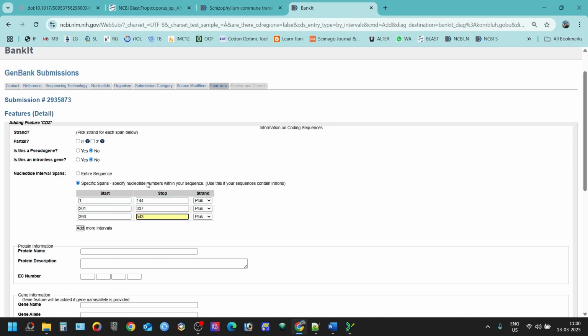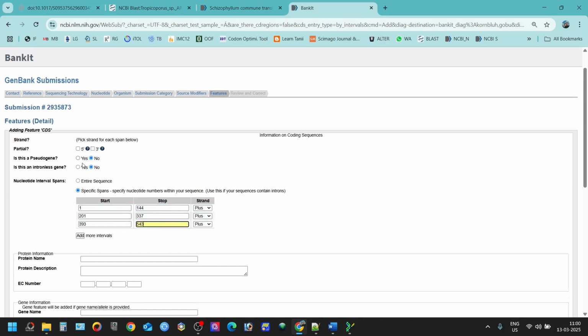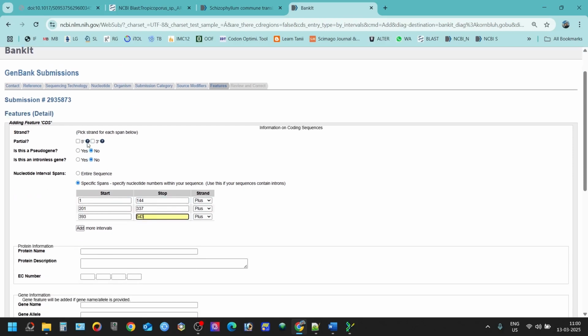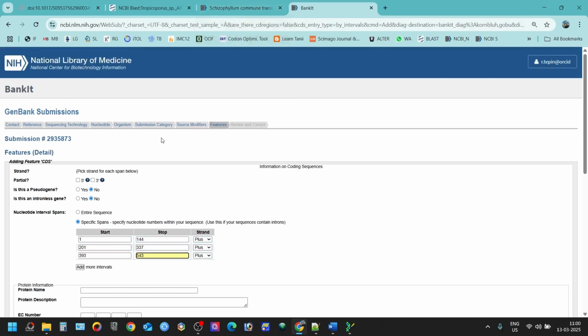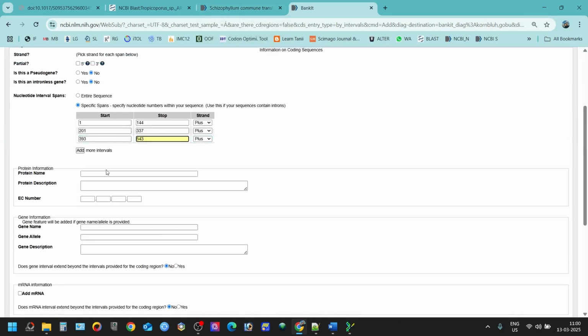The next thing that we're going to do is find out what is our strand. Is it plus or minus or whatever it is? All these sequences are plus or minus. To do that, you have to know about your protein sequence. For example, the protein sequence that I'm working on is translation elongation factor, and it is a TEF1 alpha gene.